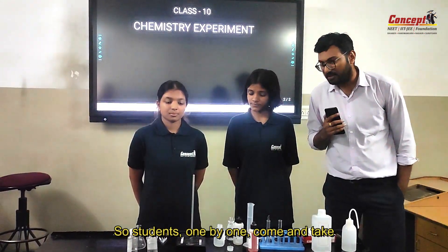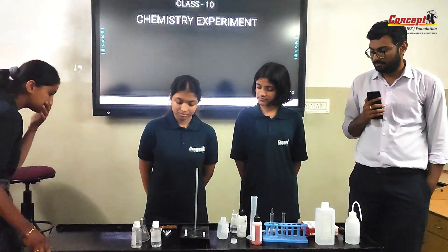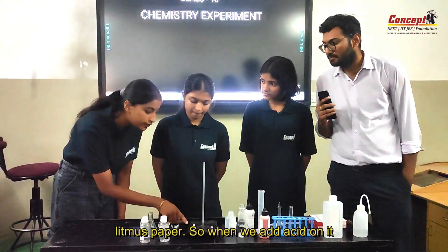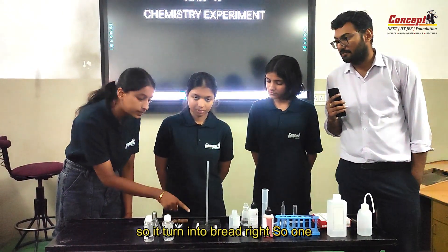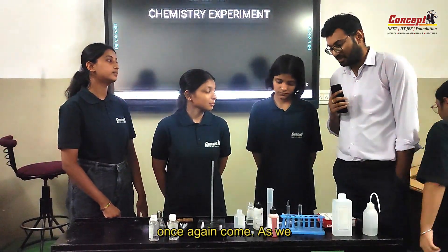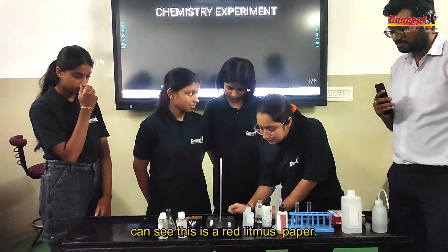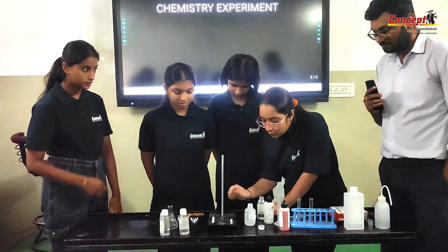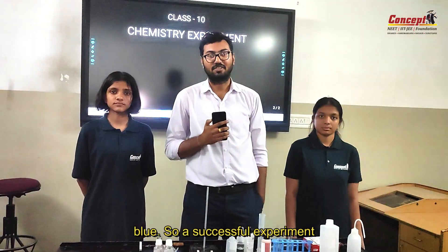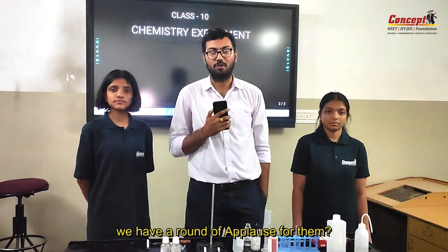Students, come one by one and take your observation. As we can see, this is a blue litmus paper — when we add acid on it, it turned into red. And this is a red litmus paper — we added base into that and it turned into blue. A successful experiment performed by these two young students — give them a round of applause!